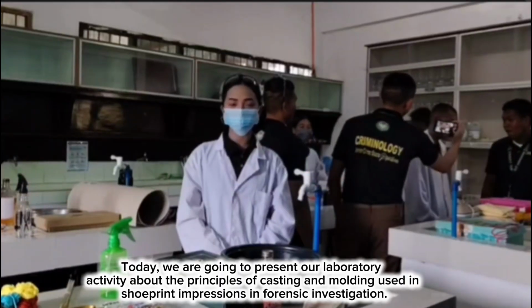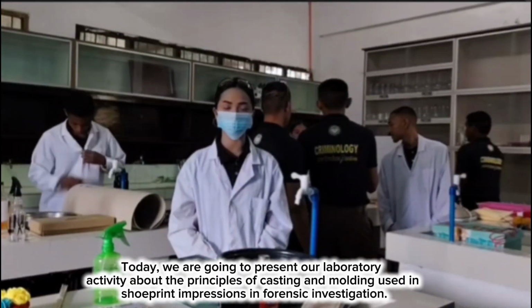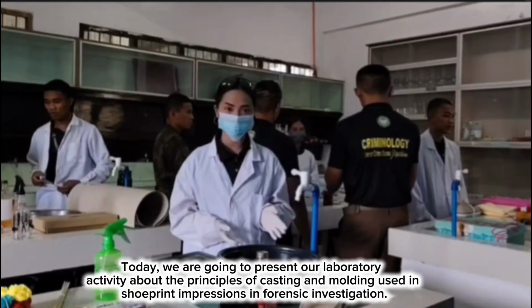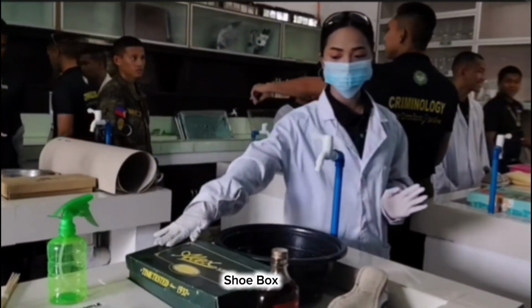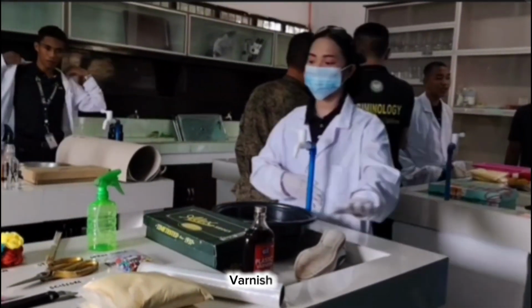Today, we are going to present our laboratory activity about the principles of casting and molding used in shoe print impression in forensic investigation. Here, we have the basin, our shoe box, known sample, and varnish.